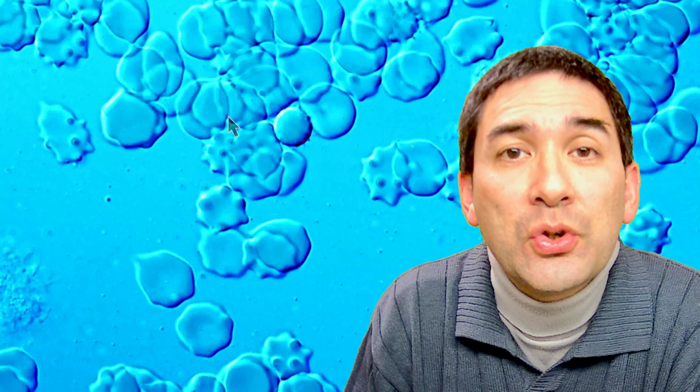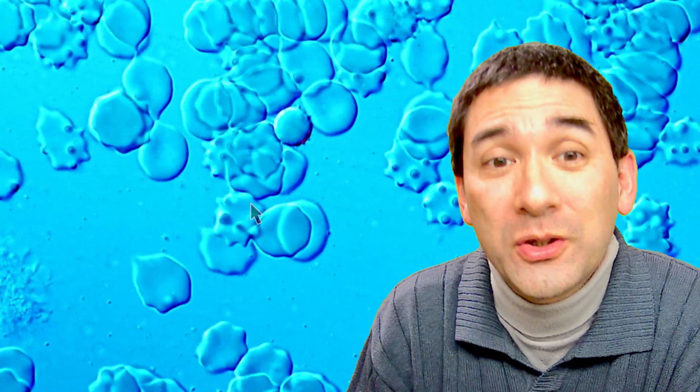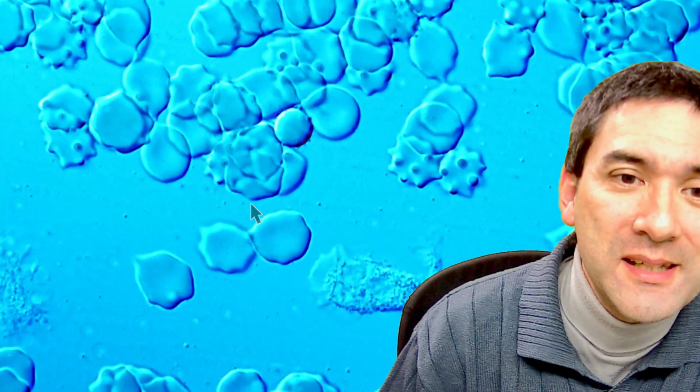Now you see a couple of others as well. So let me pause the video again over here. Here we see quite nicely those star-shaped red blood cells, because as water starts to evaporate and the blood starts to dry up, the red blood cells also start to lose water, and then they start to form into those funny looking shapes. And on the different parts of the microscope slide, you are able to also see different shapes. So in the center, the red blood cells look a little bit different, and at the edges more water is able to evaporate.